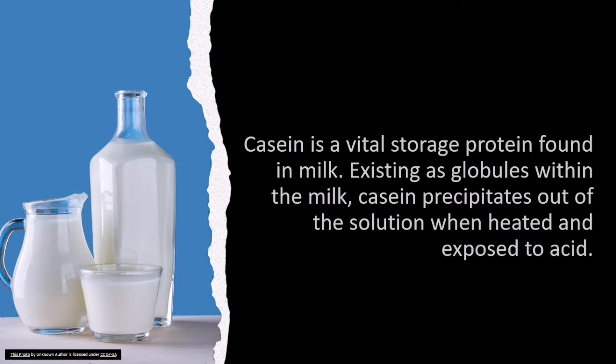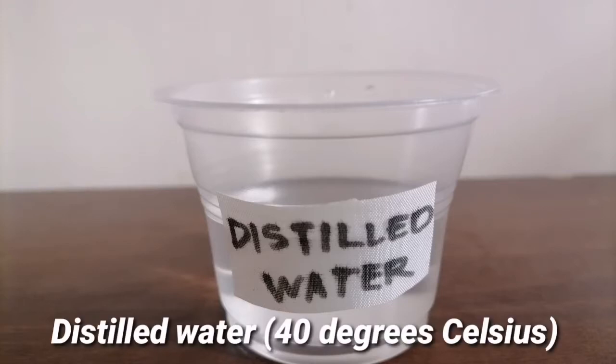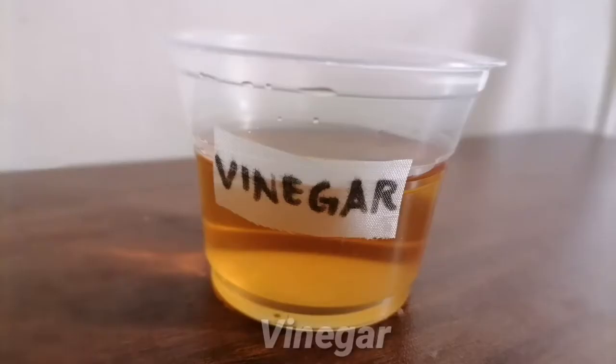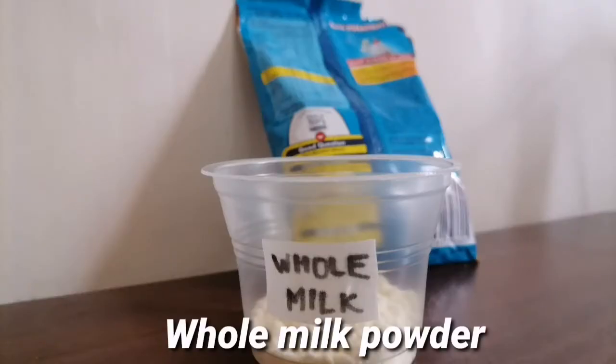Here are the materials needed for the experiment: a filter cloth, rubber band, distilled water heated at 40 degrees Celsius, vinegar, ethanol, and whole milk powder.